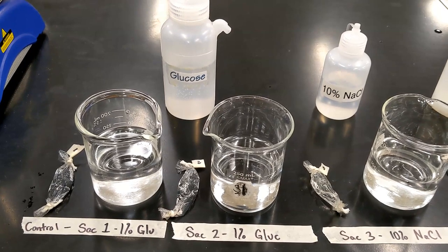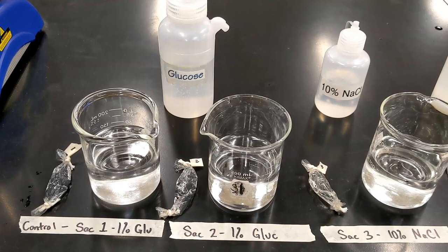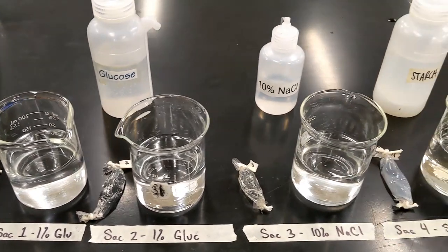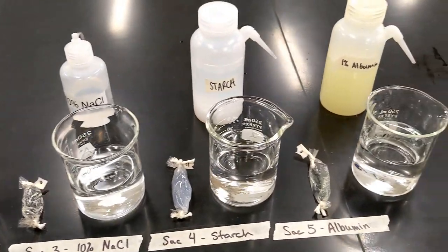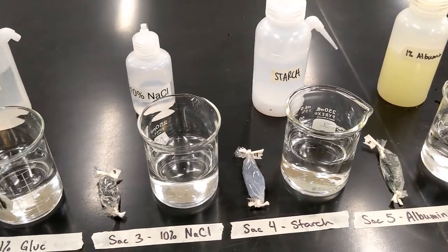This is the diffusion through dialysis bag experiment. What you see here as a setup are five different beakers. Each of these beakers contains a solution.